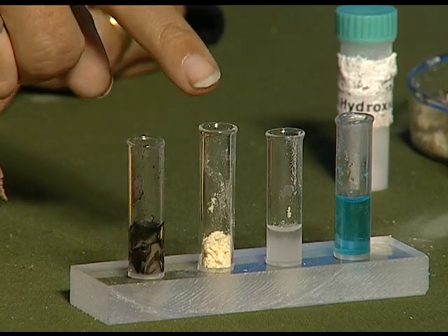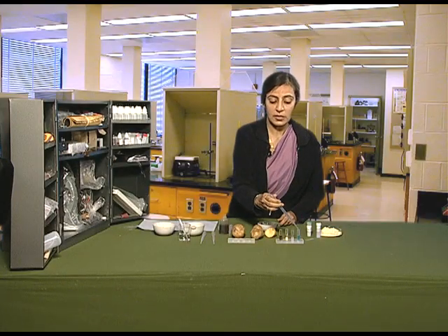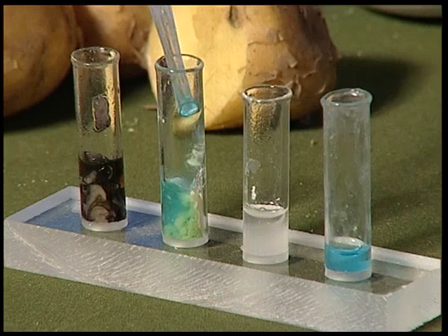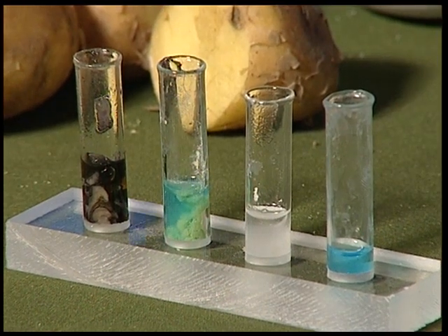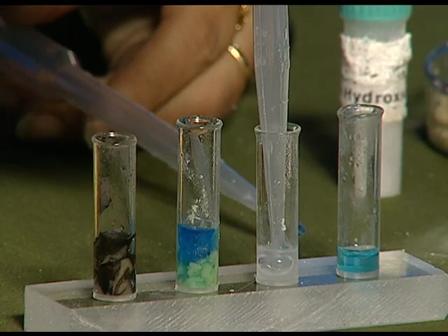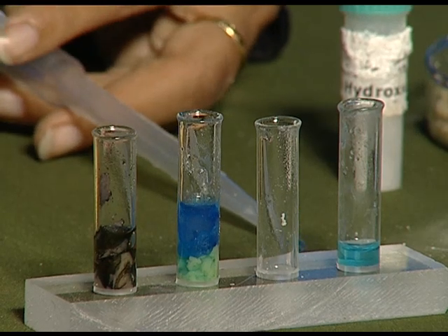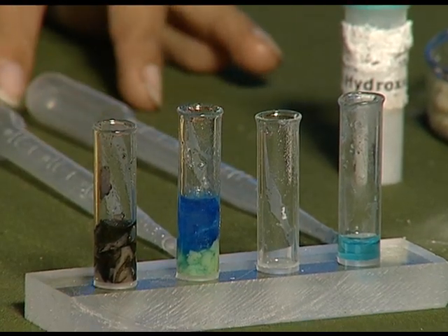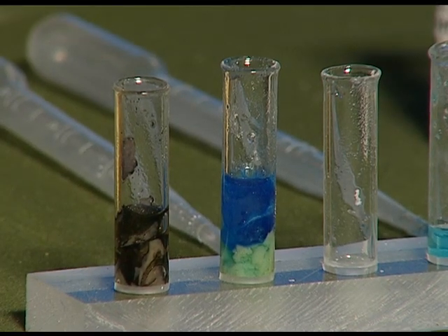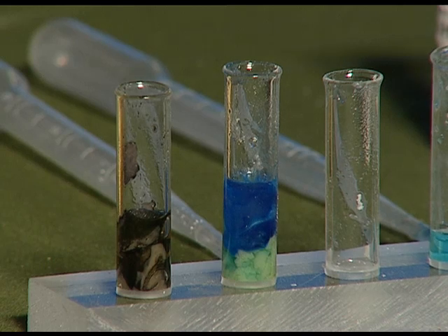In the powdered dal, we slowly add a few drops of copper sulphate solution first and wait for a few seconds. Then we add caustic soda and observe a change in color. We observe the powdered dal changes to violet color. The violet color indicates the presence of proteins in dal.